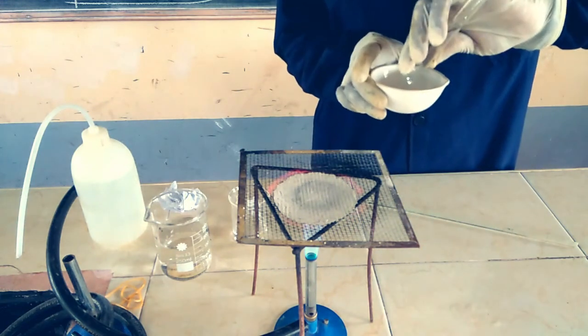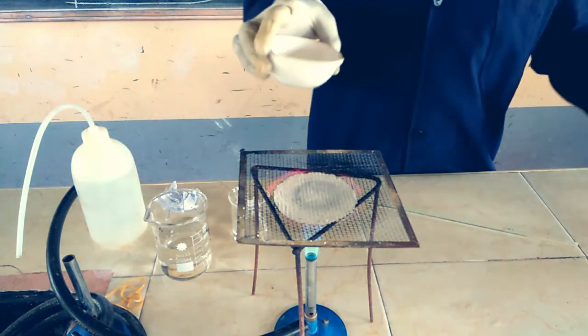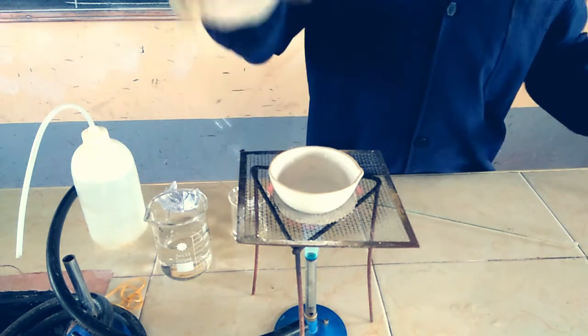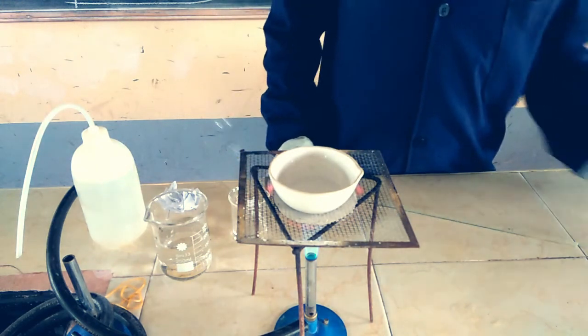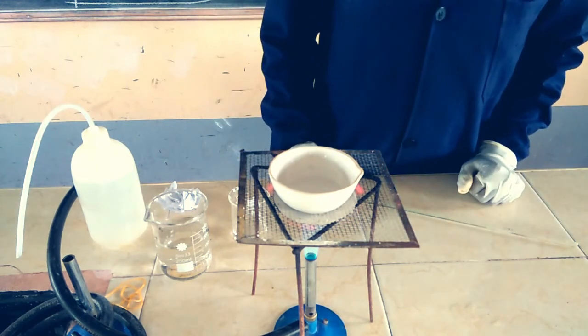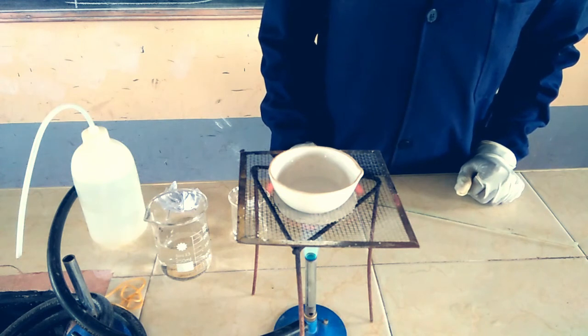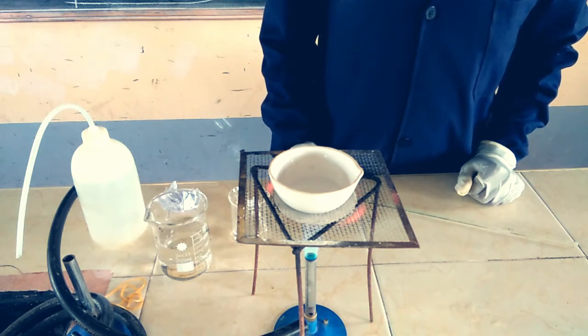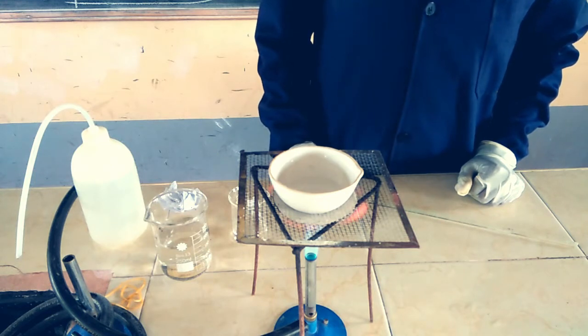I'll place it on the flame. After placing it on the flame, we allow it to heat and let the water evaporate. You can drive out excess water by evaporation.